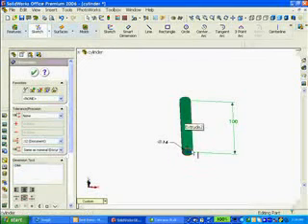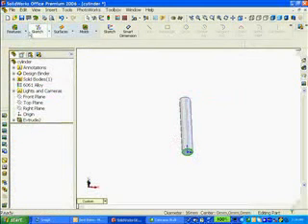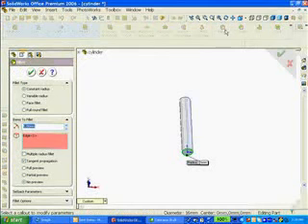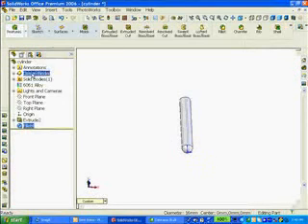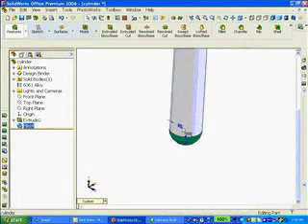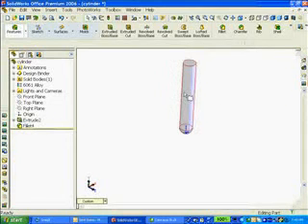I'm going to select this edge and use the fillet feature. Click on Feature, click on Fillet. The fillet that I'm looking for, I'm going to try a radius. I know my diameter is 16. I'm going to use a fillet radius of 8 so that I get a nice rounded end. Again, the radius is half the diameter. So whatever test tube I use, I can use the fillet feature to round off the bottom, as long as the radius is half the diameter.